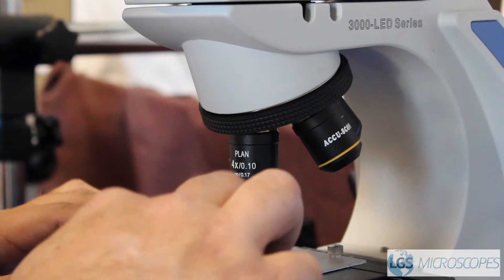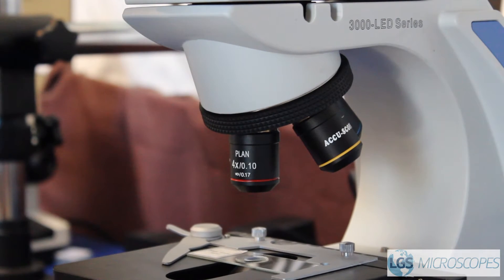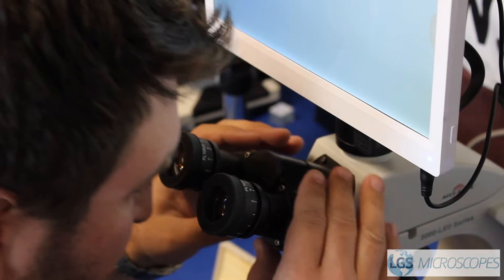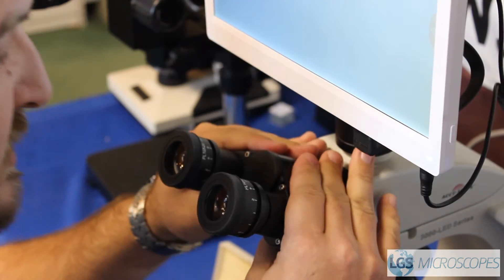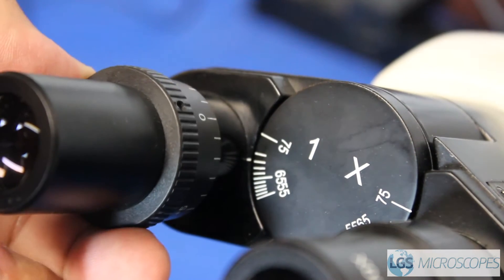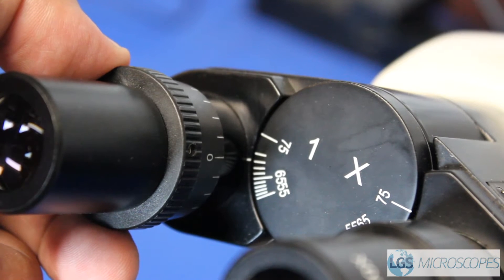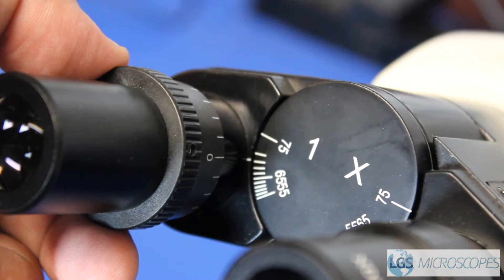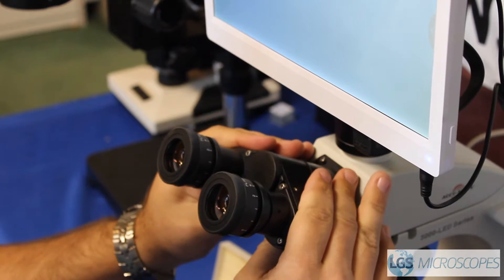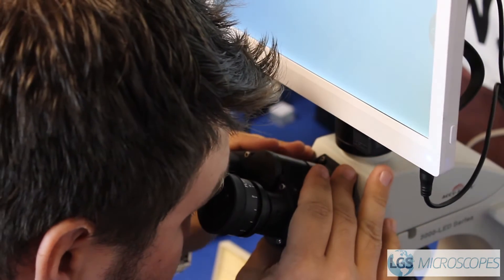You can go ahead and pull out this little arm here, set your slide in there, and you want to get it centered over the condenser lens. Now you can go ahead and set up to look in your eyepieces. You want to make sure your diopters are set to zero, or wherever is best for you — you can always reference back to our video on how to use a diopter. You also have what's called the interpupillary adjustment, which allows you to set the distance between your eyes depending on each person.